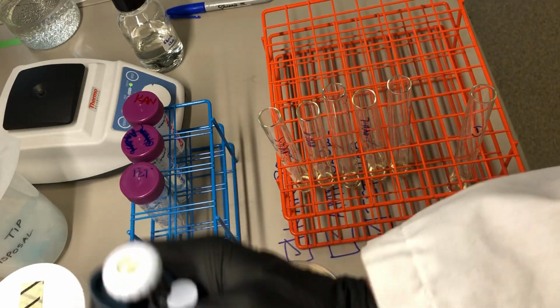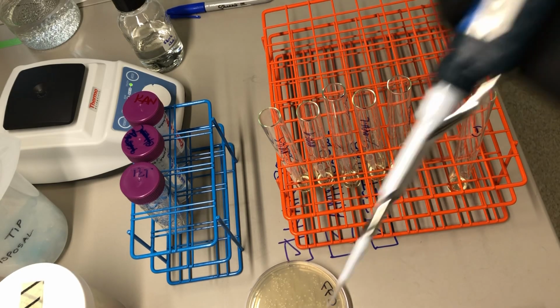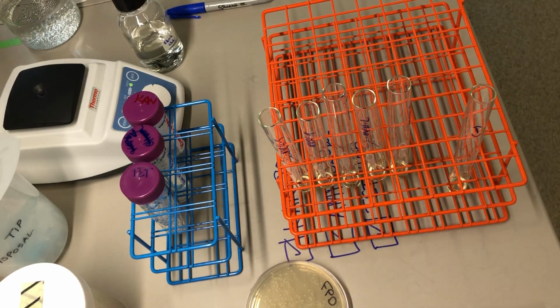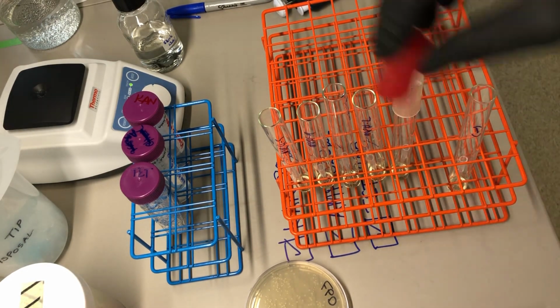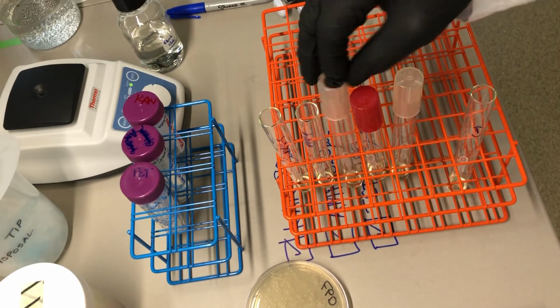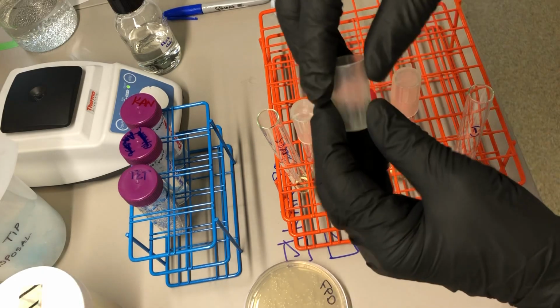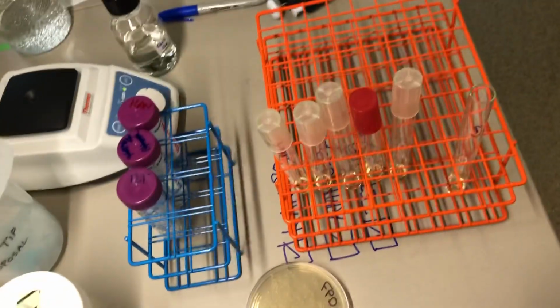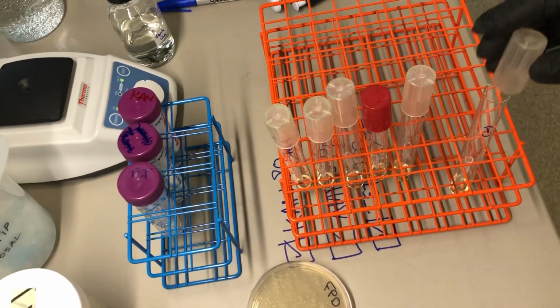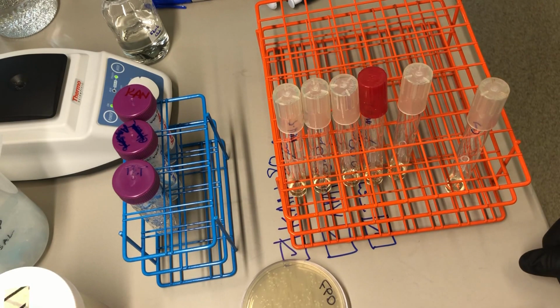And then for my negative control, which you don't need to do, the TA will do this for us. You just take a tip and don't touch it to anything and just eject the tip, and that'll be the control. Put the caps back on. And then the TA will collect these from your bench and move them into the incubator at exactly the same time so that everybody gets a fair start, and they will grow for 18 hours.